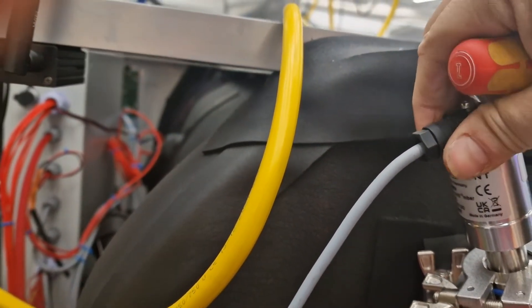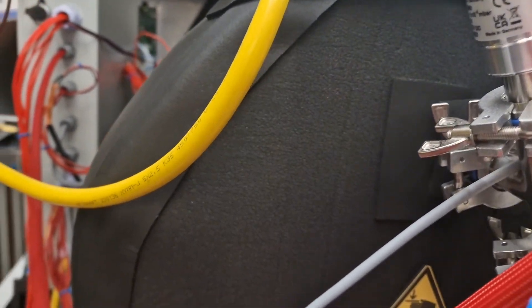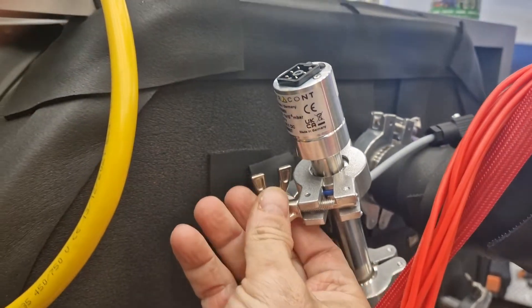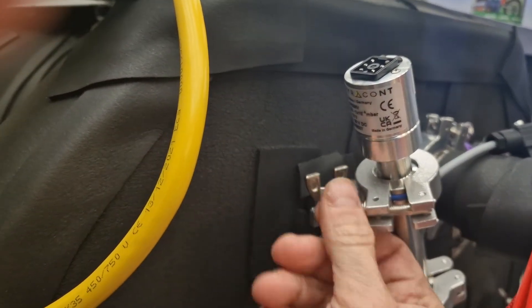Take it all the way out and take the plug out and remove the sensor.